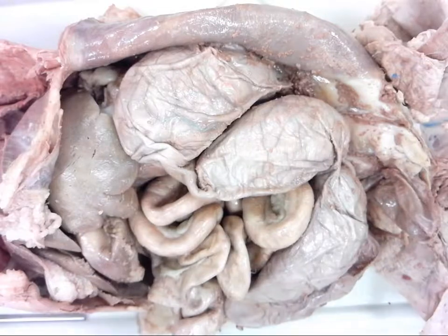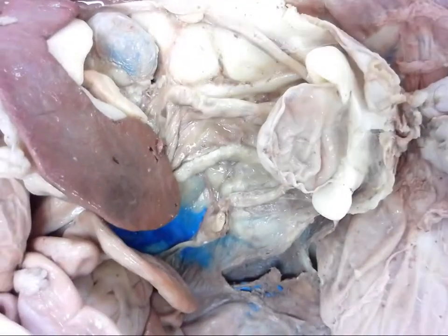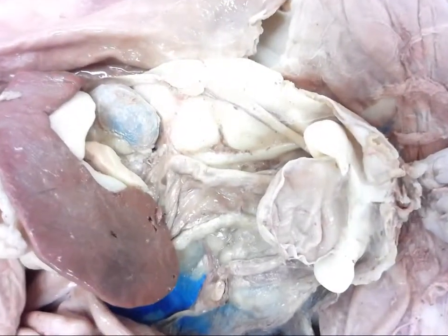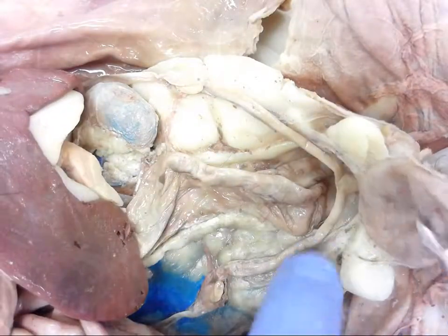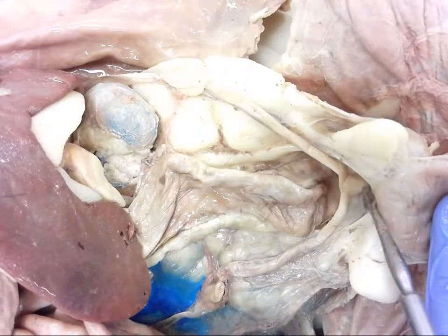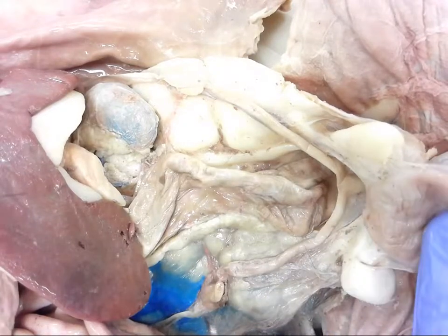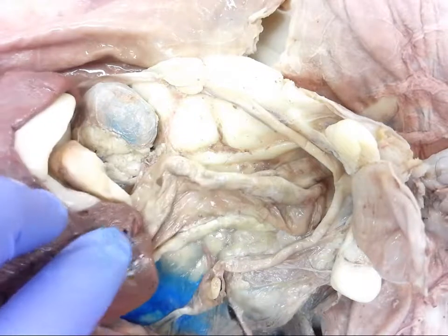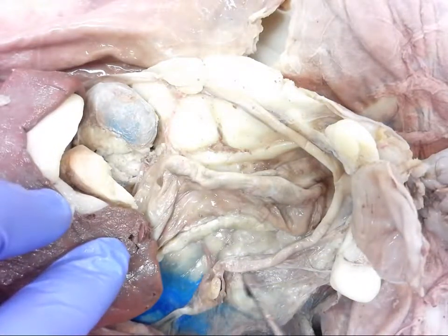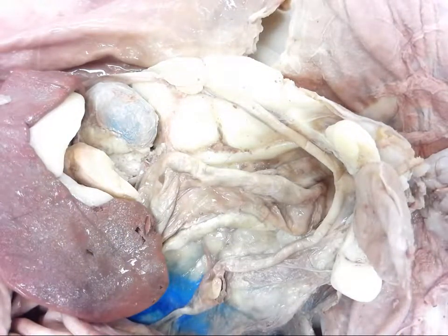Let's go back over to our non-pregnant specimen and do a quick review. This is sitting in the back of the abdominal wall - we've moved the intestines out of the way, the bladder sits on top, and if we lift that up and move it out of the way we have the uterus, the uterine horns going down to the fallopian tubes and the ovary. Technically if you're looking at egg movement it's going the opposite direction. Just a quick overview of what we have with felines and what you will see in the female reproductive system.